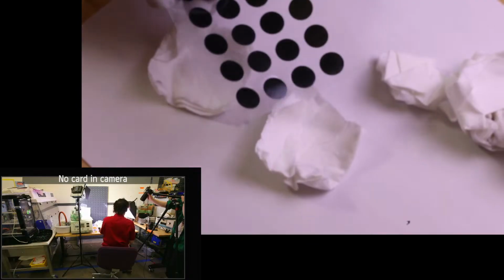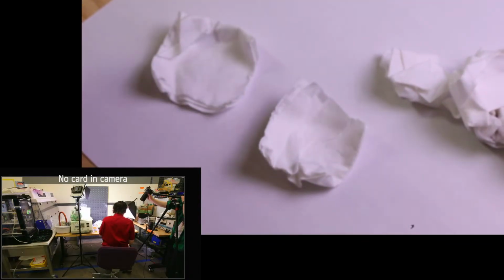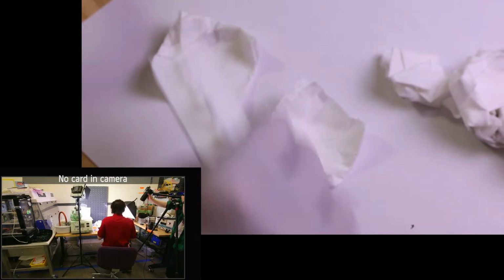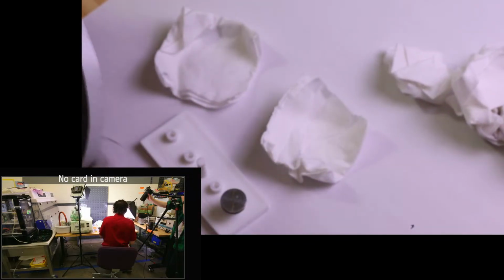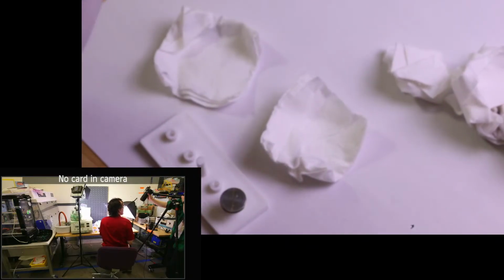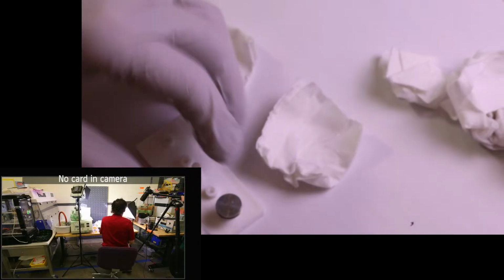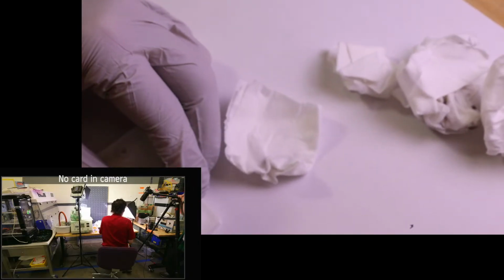We're going to be using a conductive carbon. I hope this one's conductive. I did have one set of them that was a little bit weird. Oh, these are the really smooth ones. Okay, you know what? Actually, we're going to do the one I know is going to work fine, and that's going to be our conductive carbon tape. One time I ended up with a set of carbon dots that wasn't actually conductive. I know, right? They've spread.